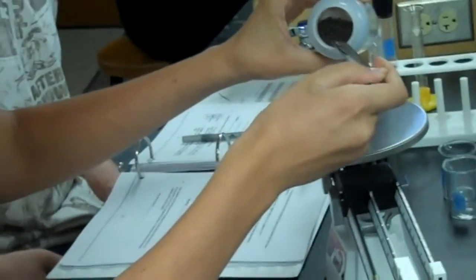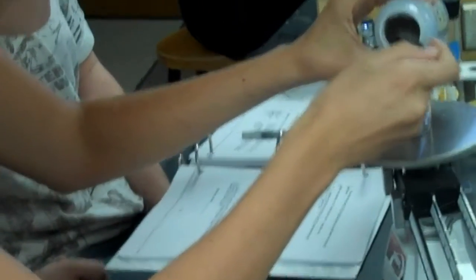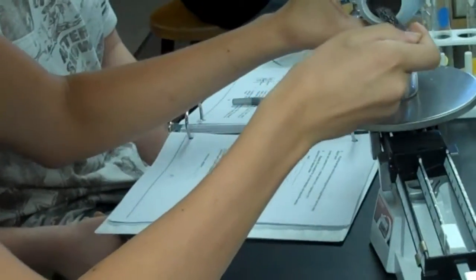You just dump some in there, forget the scoop. Just don't miss. There, that's getting better. You can do a little more if you want. Awesome, I'm gonna do a lot more, because I'm going to reuse this chemical tomorrow. Okay, good. Go ahead and seal that up so we don't get it contaminated. So that's a lot of lead.